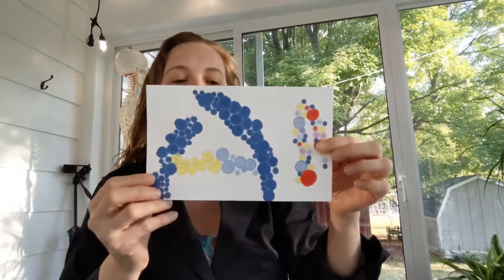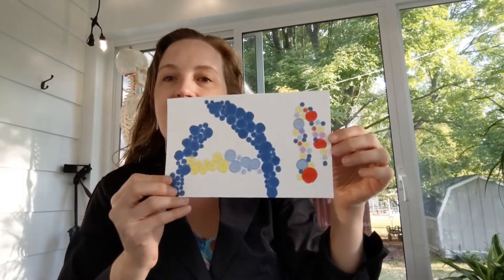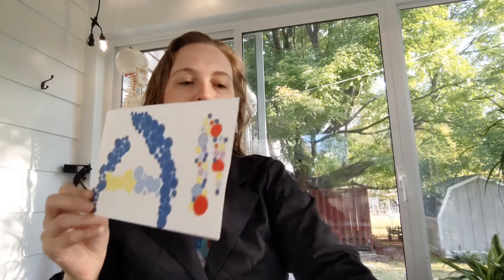So I'm excited about this because it combines the skill of pipetting with artistic experience. And kids are going to end up making something like this.